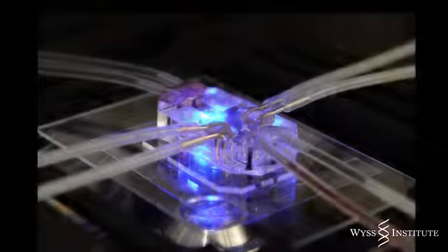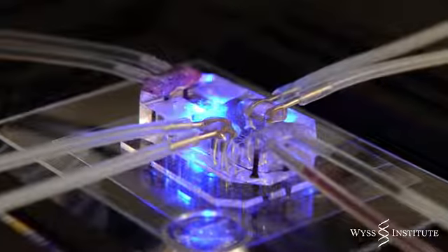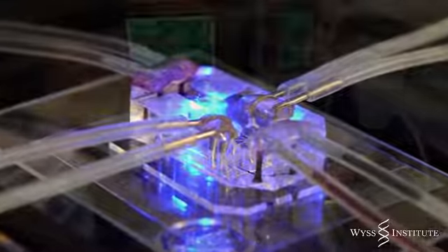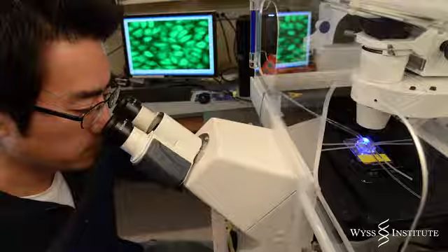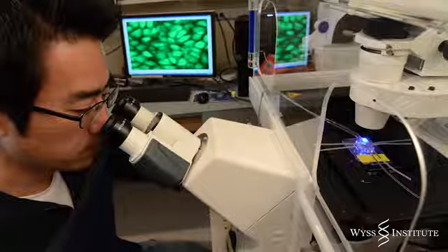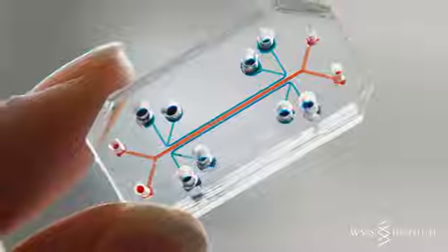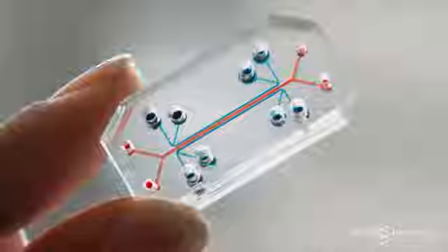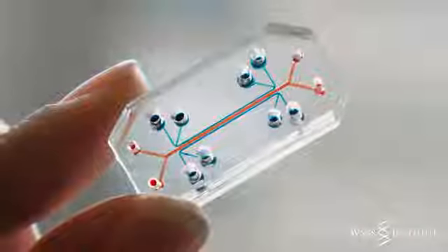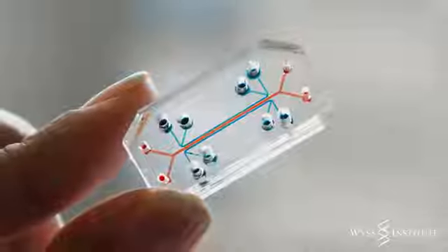The lung on a chip can also mimic the toxic effects of airborne nanoparticles on the lung. In fact, experiments with the device led to the prediction that breathing increases their absorption into the bloodstream. This has been confirmed in animal studies. Bio-inspired microdevices that can mimic whole human organ function, such as the lung on a chip, could potentially replace animal testing and bring new therapies to patients faster and at lower cost in the future.